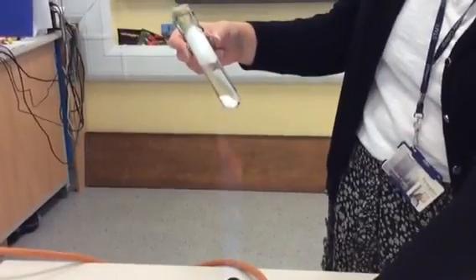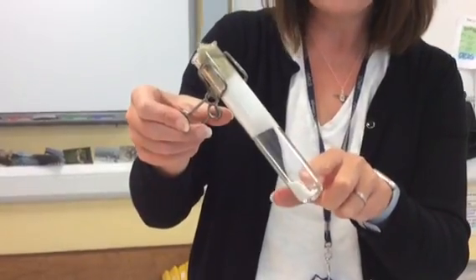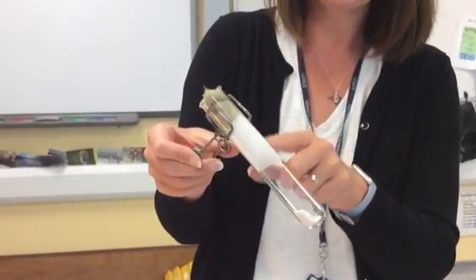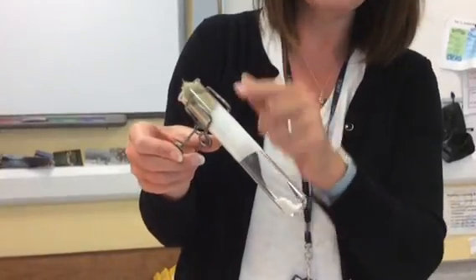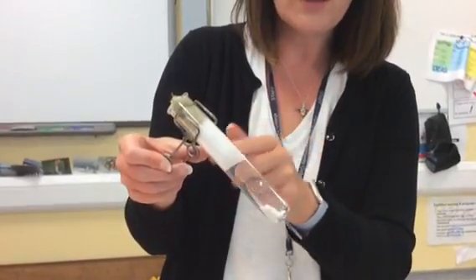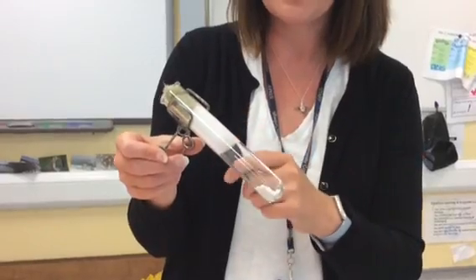If I turn this to a safety flame and leave that there for a moment — hopefully you can see in the boiling tube there's white solid at the bottom, but there's less of the white solid than what we started off with, and the boiling tube definitely looks different to what it did at the beginning of the reaction. At the beginning it was completely colourless all the way up, it was transparent, we could see through it. Now it's got this white coating all the way around it, and we need to be able to work out what that white coating is.